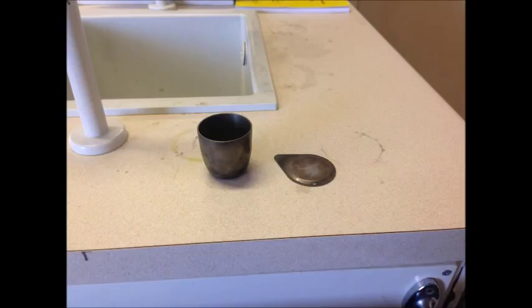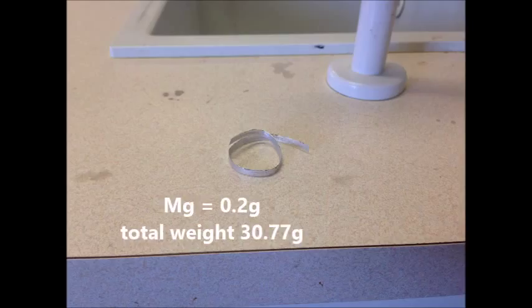First of all, you're going to want to weigh the crucible and lid. For us, that was 30.57 grams. Then, you're going to want to weigh your magnesium ribbon. For us, that was 0.2 grams. Now you add these together, this will give you a total weight.